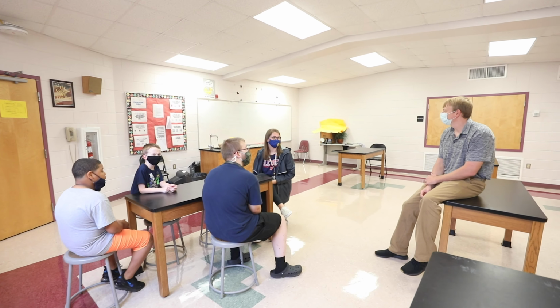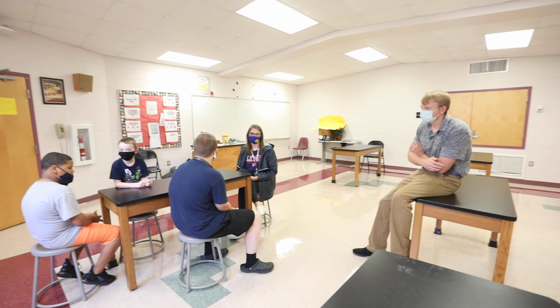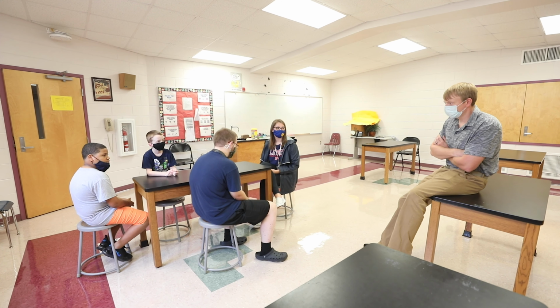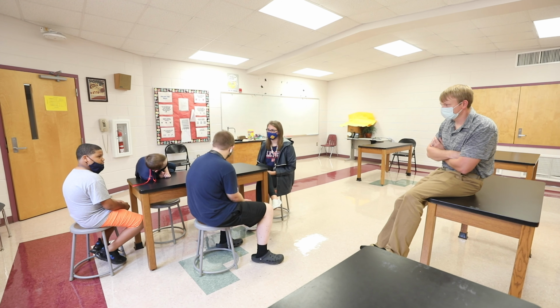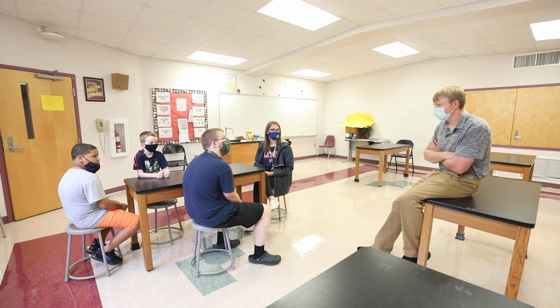Some of you may have seen them a little bit, but I think most of you haven't looked at them yet. What do you think happened? Keep in mind what we did to begin with, right? We took the Q-tip. You were given an object. You rub the Q-tip on the object and you put it onto the agar tray, right?